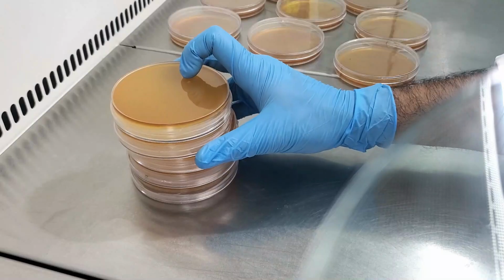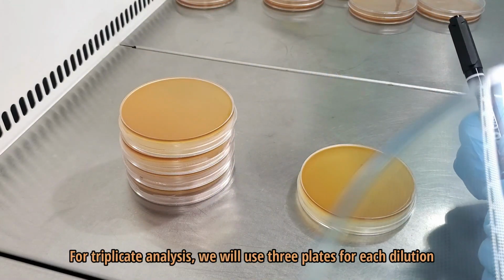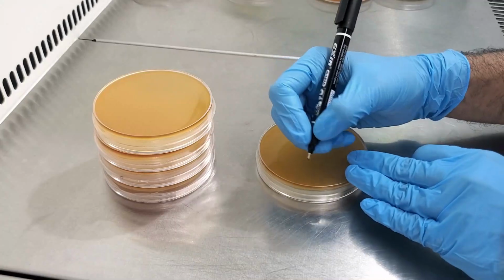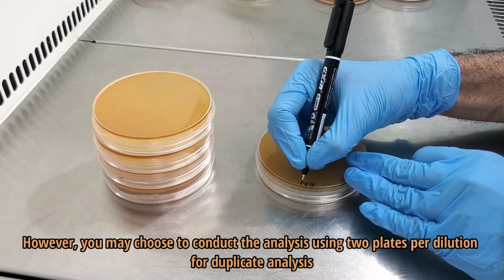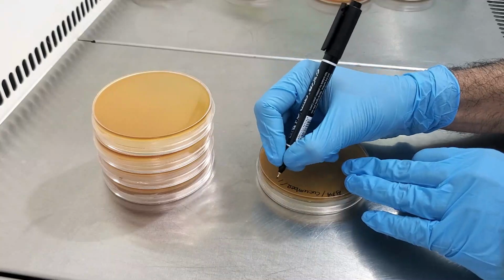Next, we will inoculate the prepared sample onto Baird-Parker agar plates. For triplicate analysis, we will use 3 plates for each dilution. However, you may choose to conduct the analysis using 2 plates per dilution for duplicate analysis.